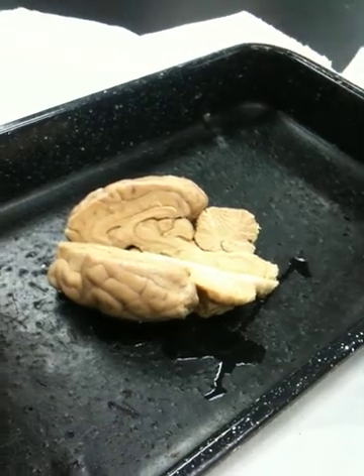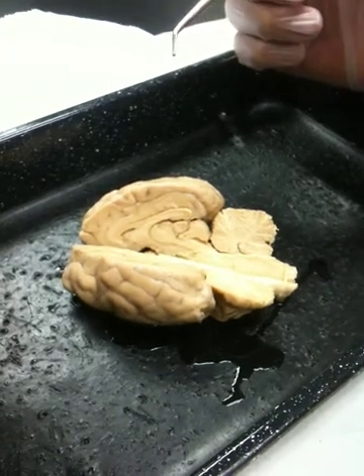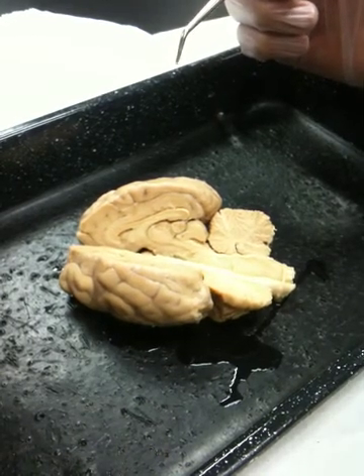Structures of the sheep brain and eye. This is the last lab in the second unit. We're going to begin with the structures of the sheep brain, covering them in the same order that they're in their lab manual. And we'll begin by looking at the external features of the sheep brain.